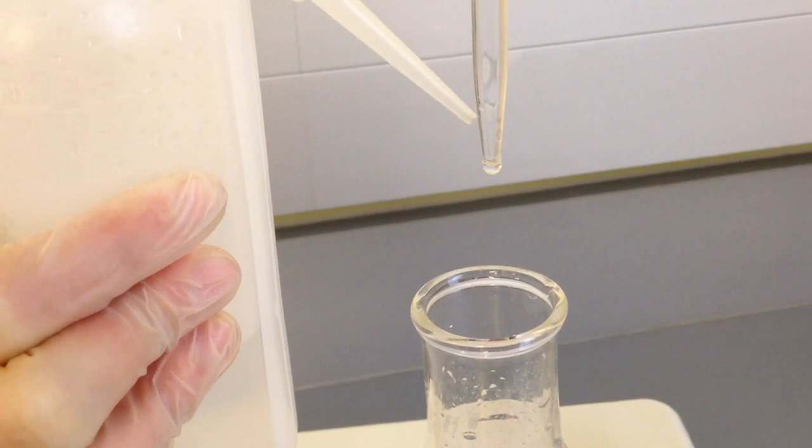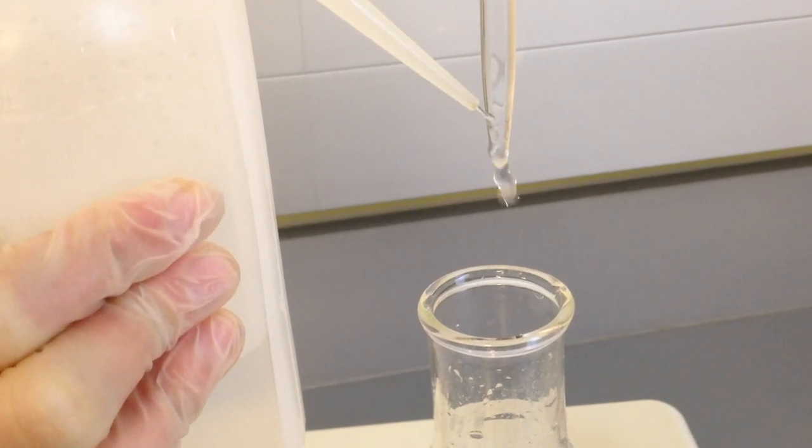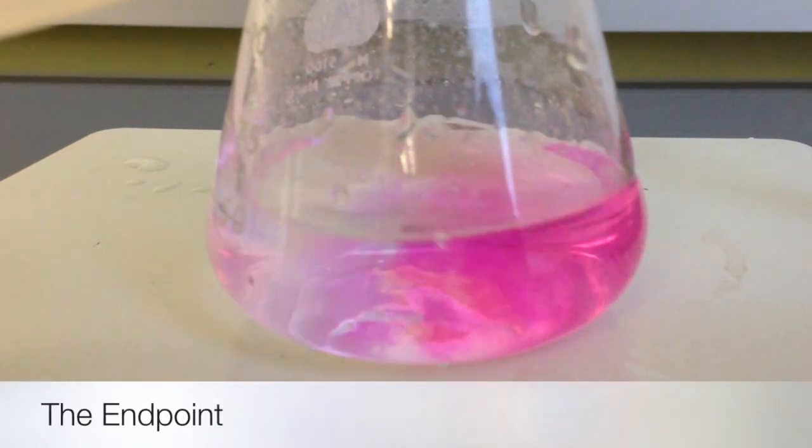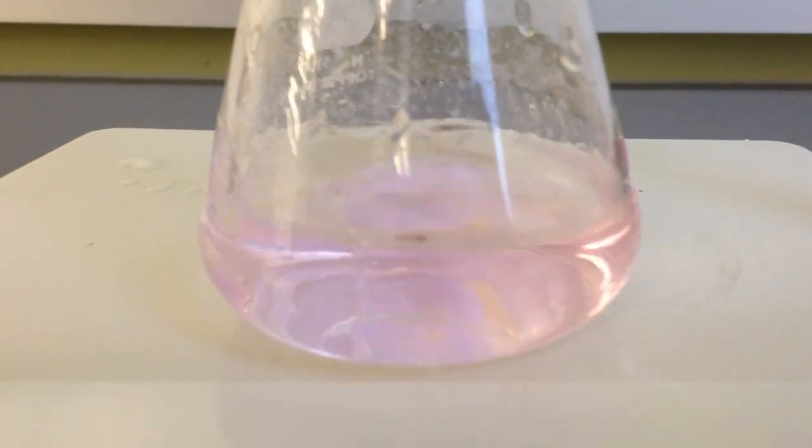Rinse the tip of the burette with DI water to put the half drop in solution. The endpoint is reached once a pink color appears and lingers for about 10 seconds.